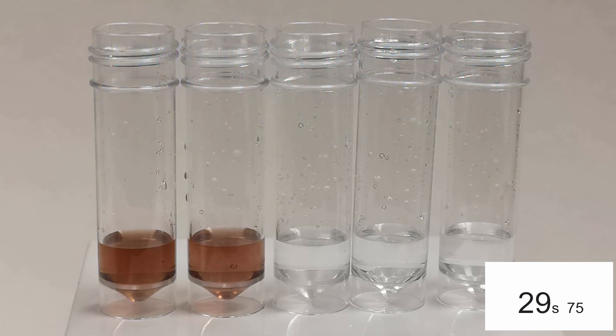This particular set of tubes is in decreasing order of concentration from left to right.